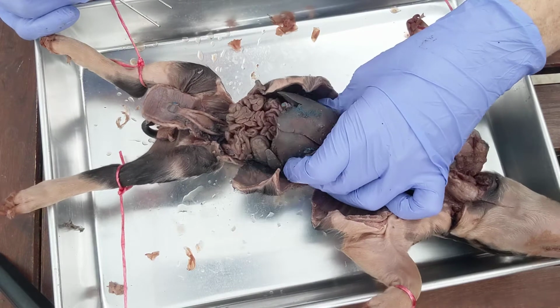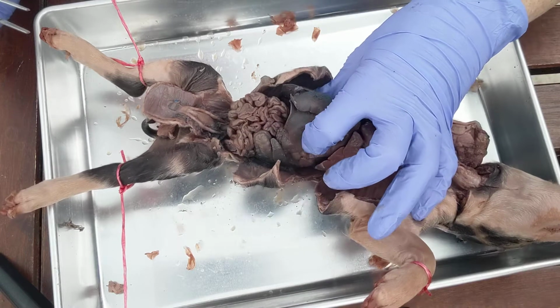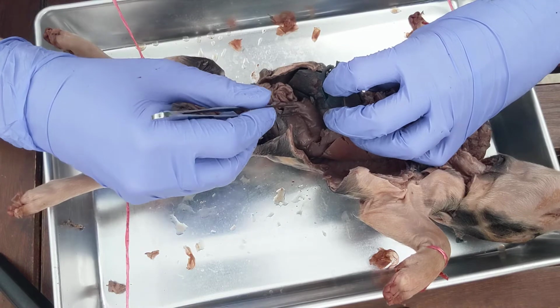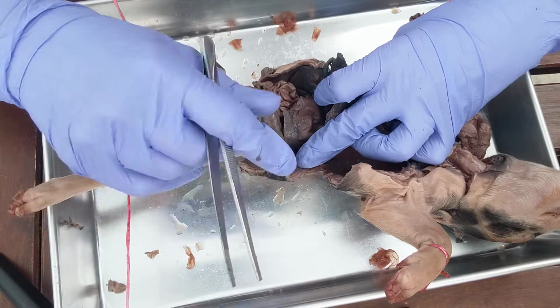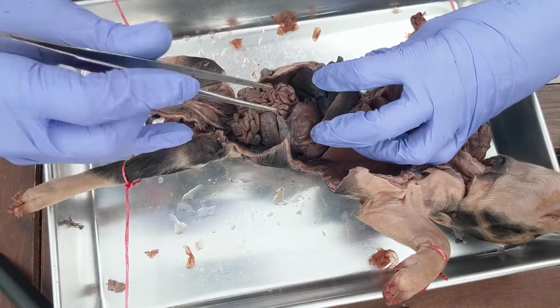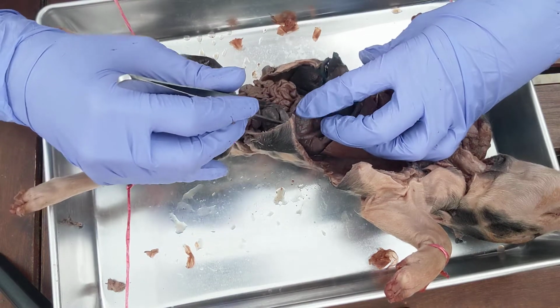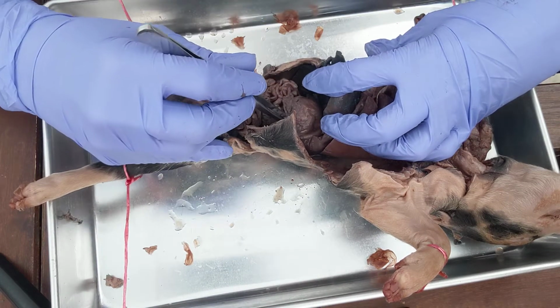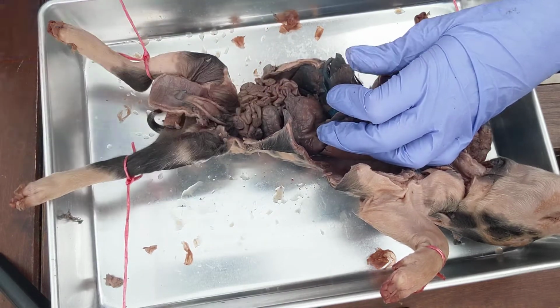So this big structure here, all of this textured stuff, this is the liver. And if you take the liver and kind of pick it up, behind it you'll see a pouch. This is the stomach. And coming off of the stomach is another textured structure. It looks a lot like the liver, but it is definitely smaller, and it's going to be just to the left of the stomach, attached by this soft structure, which is called the greater omentum. That is called the spleen. So this is the liver, this is the stomach, this is the spleen.